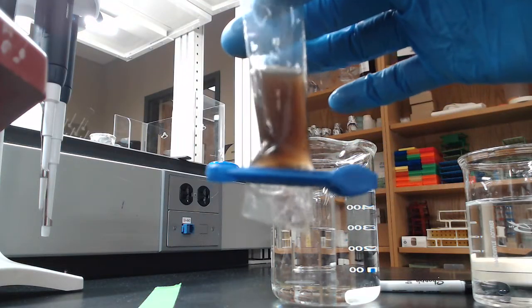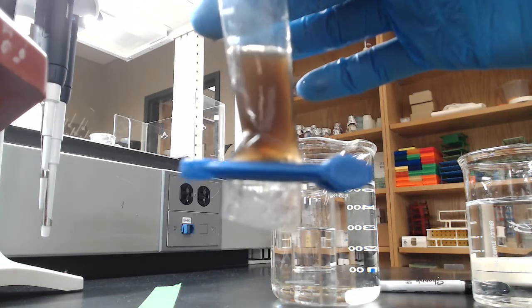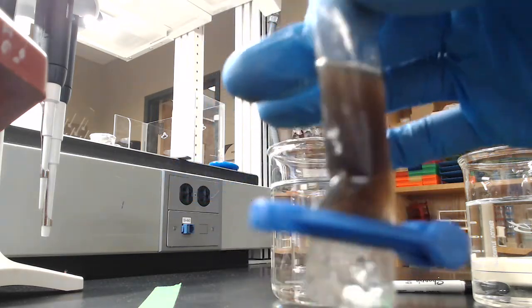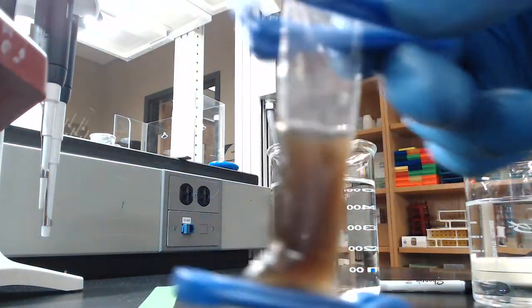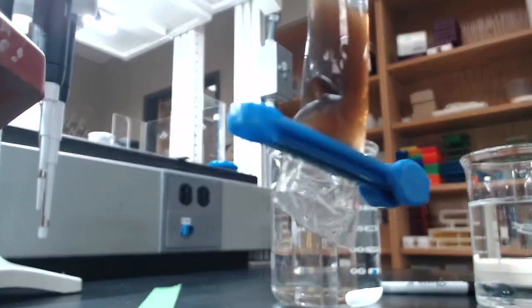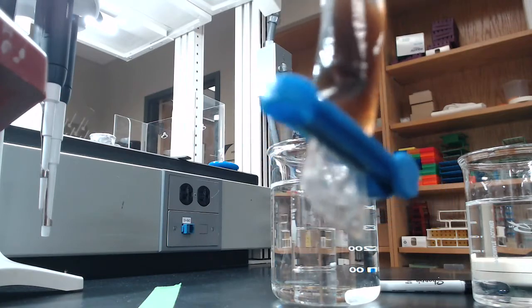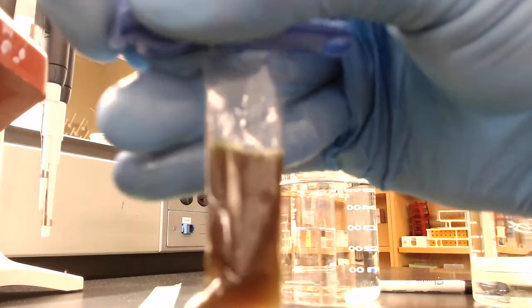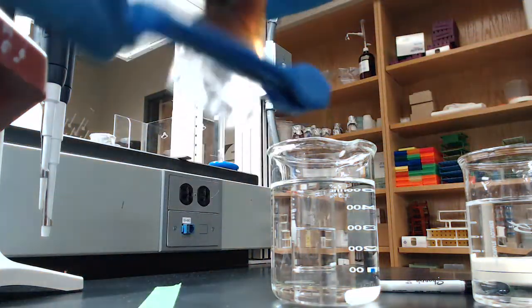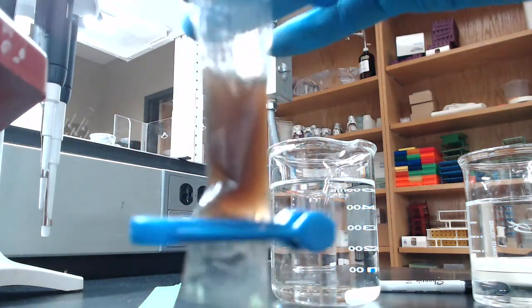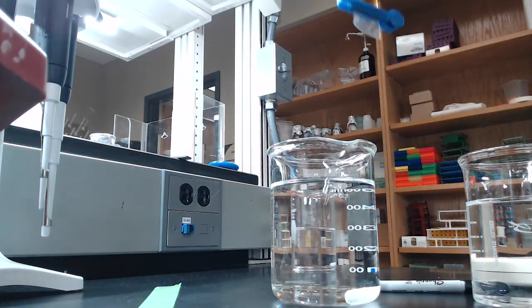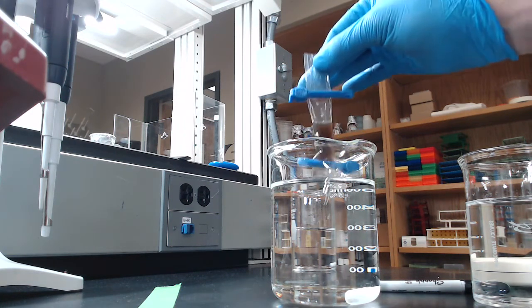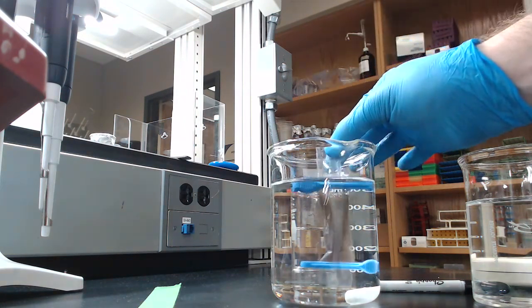It would seem I judged the length of the tubing just right, and of course we are getting leaking down here. So that's kind of a problem. All right, so I believe I've got the leakage problem fixed. It's a shame we lost maybe about two or three hundred microliters of sample, so not a huge deal, but you never want to lose sample if you can avoid it. So what we're going to do here is we want to clamp right up here. We don't want to clamp so that there's no air in there, because the air is going to actually help maintain a little bit of buoyancy. There we go. So there's a little bit of air trapped in there, but that's actually good. That buoyancy is going to help us with the whole process here.